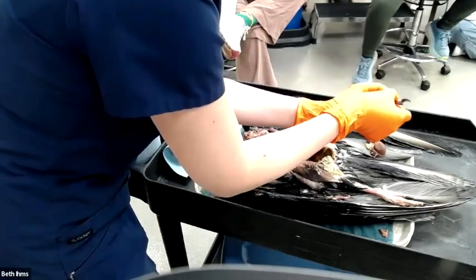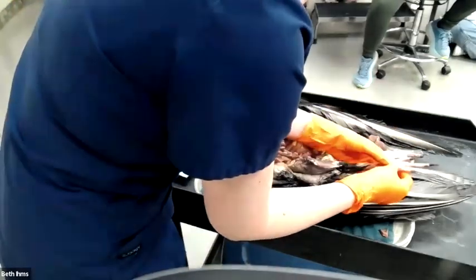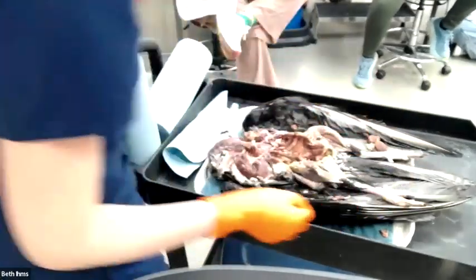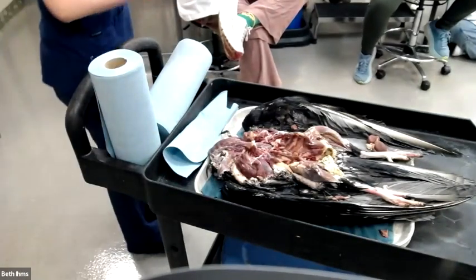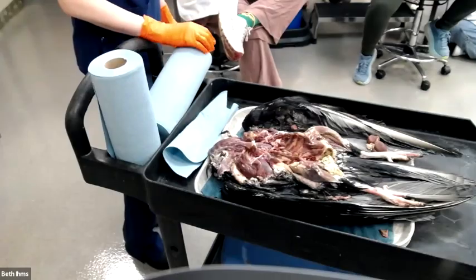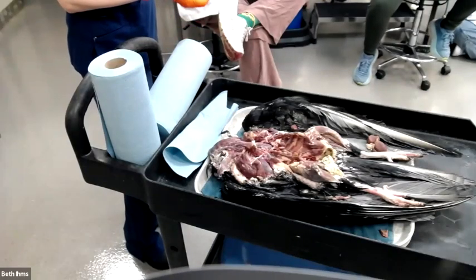That one maybe feels a little bit big. The one that's dark actually feels a little bit swollen. So potentially, but you would need to really cut into those joints to see it. Good question. It hurt, either from gout or from a bacterial infection.